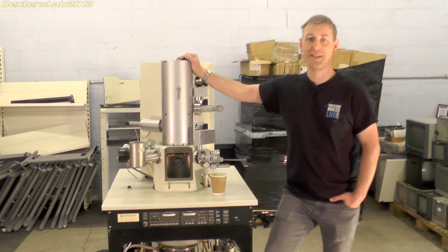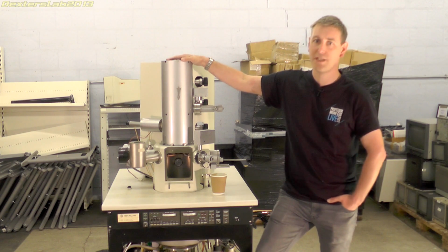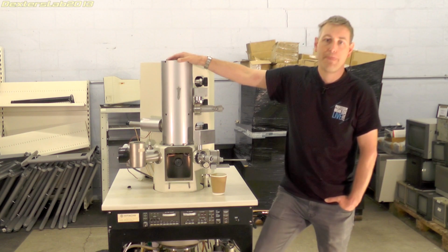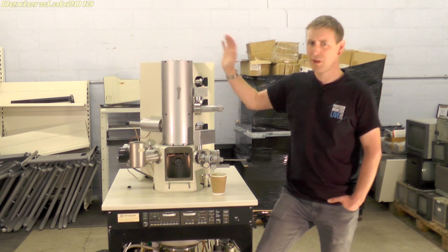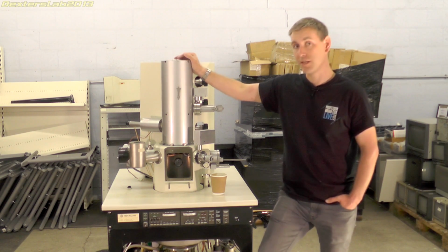Right, so let's get started. Let's start at the top. What I'm going to do is quickly describe each component working downwards. Later in the disassembly, probably in another video, I will go into more detail about each of the items.